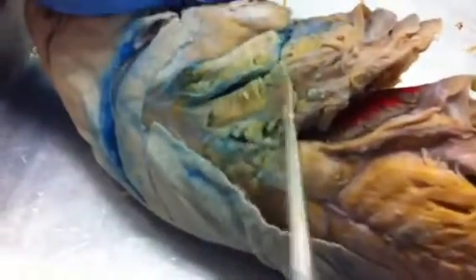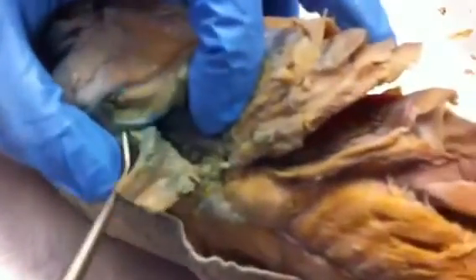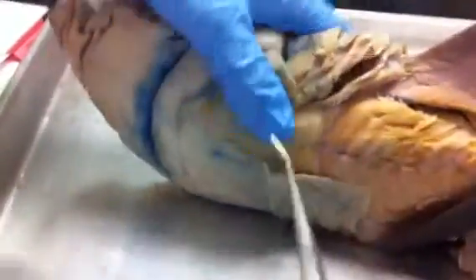Okay. So this whole thing is the intermandibular because it connects to the mandible, and when you lift it up, because inter means between something. Right. And so when you lift this up, as you can see here, you've got two layers of muscles. The yellow one is the intermandibular muscle, and the one above it, the one that's medial to the body, is the interhyoid muscle. But collectively, when the shark is normal, you see the intermandibular.